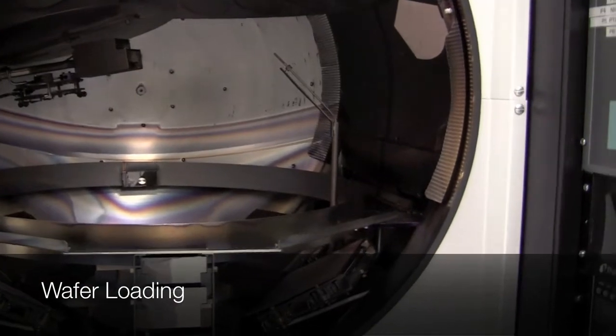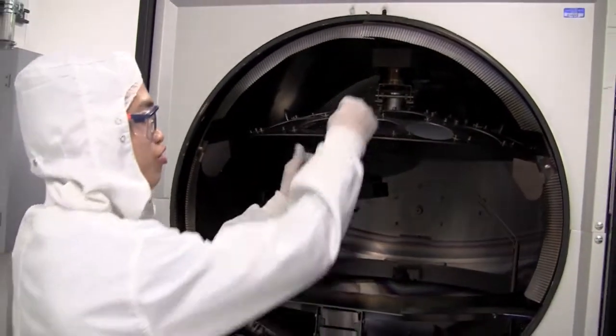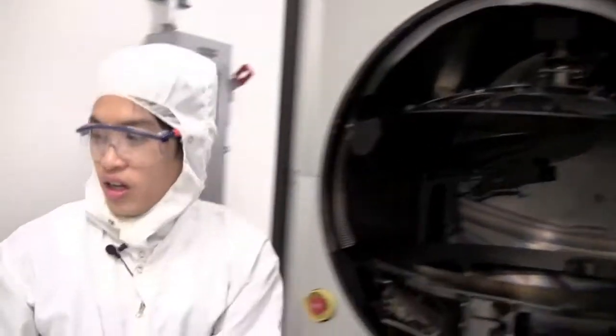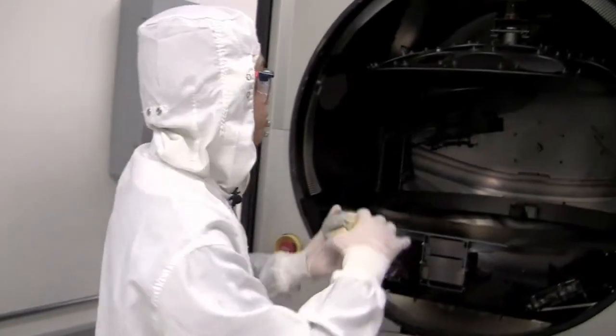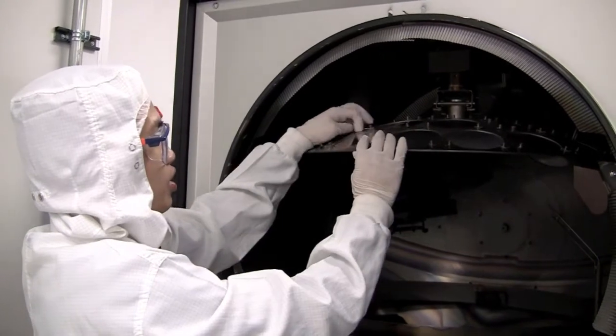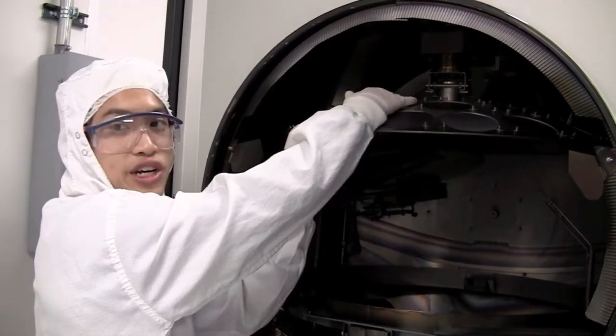And now we can begin to load our wafers. To do so we will remove the placeholder wafers and replace them with our own samples. You want to verify that when you put your wafers on that they won't wiggle during deposition.